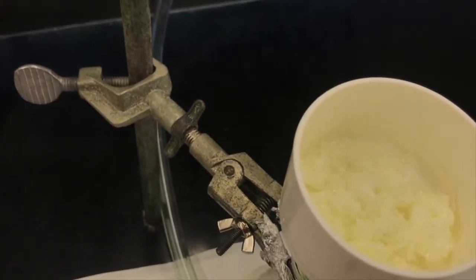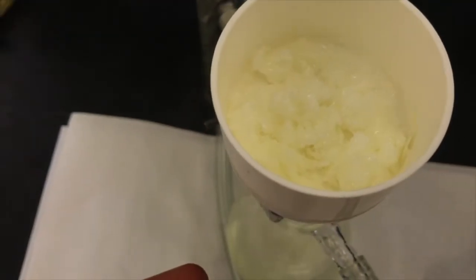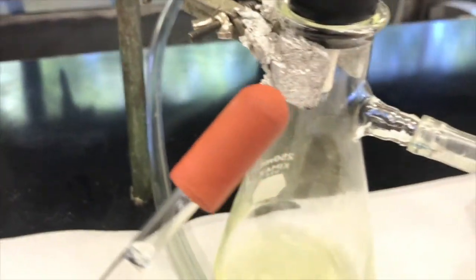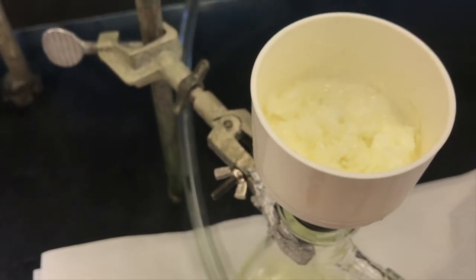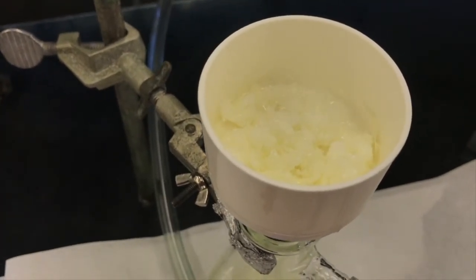And this whole process is not 100%. I'm going to lose some yield, but I'm going to gain a lot of purity. These crystals look really nice. They're kind of shimmery. I don't know if you can see it well in the video. And you can see the mother liquor being drawn through. There's not a lot of crystals in the mother liquor, so it's going pretty well. So I'm going to let the crystals dry under vacuum for a couple minutes, and then I'll let them air dry longer. And then I'll get my weight of my final crystallized benzoin.